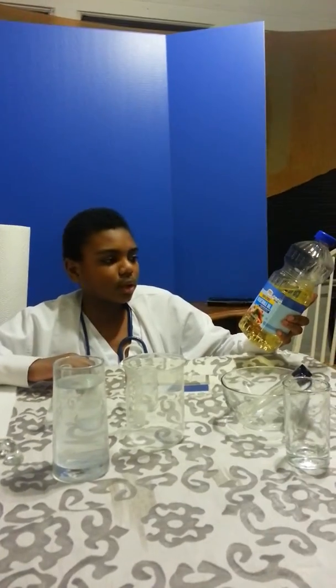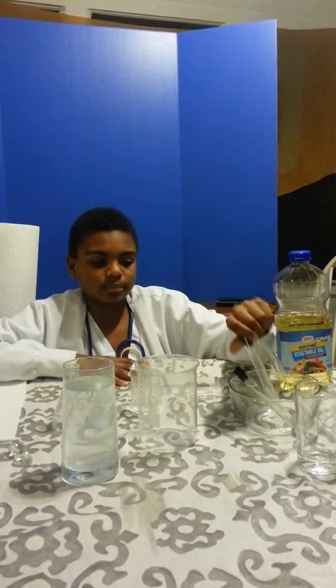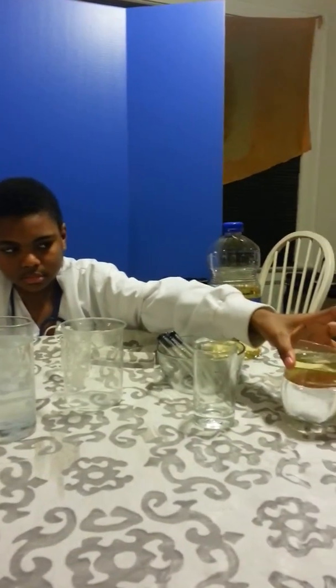My lab report is the disappearing glass. The materials we will be using are cooking oil, known as canola oil, and glass Pyrex beakers like these. I will also be using glass test tubes like these, and other glass materials like this. I added a prism, 3 glass rocks, and plastic just for the fun of it.